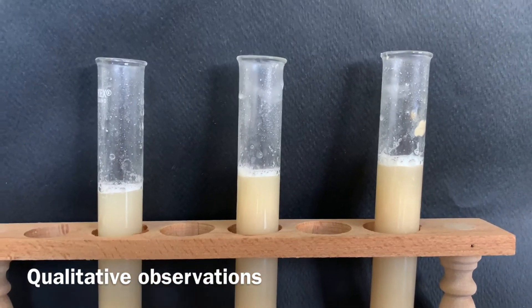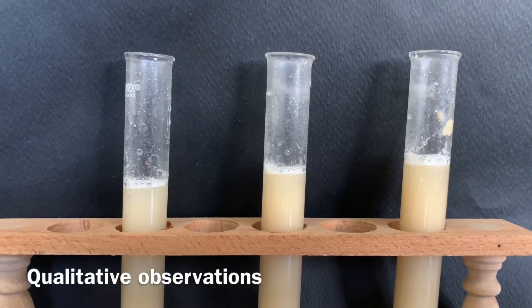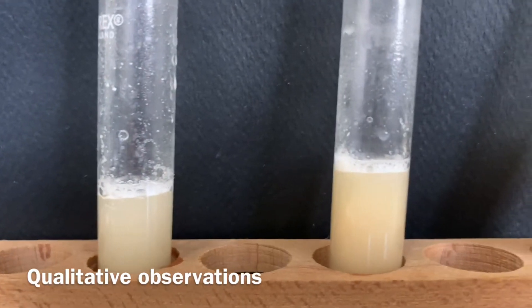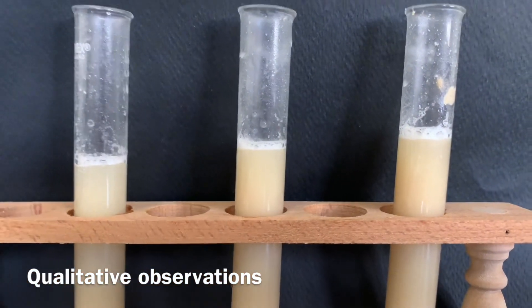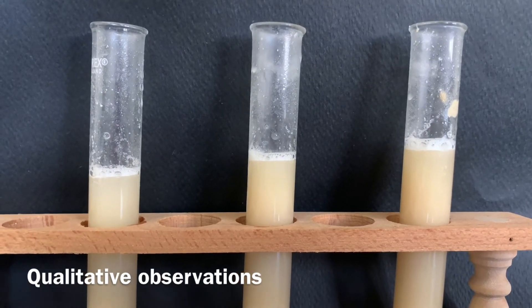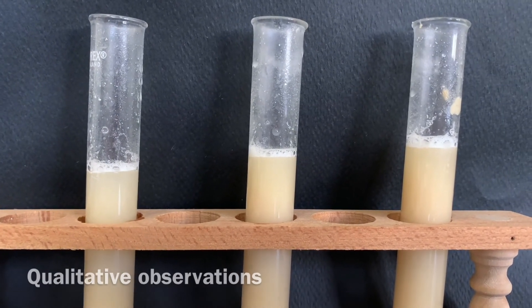These bubbles that were formed, or the foaming that you see here, is basically caused by all of the carbon dioxide that was produced by the yeast as the yeast underwent alcoholic fermentation.